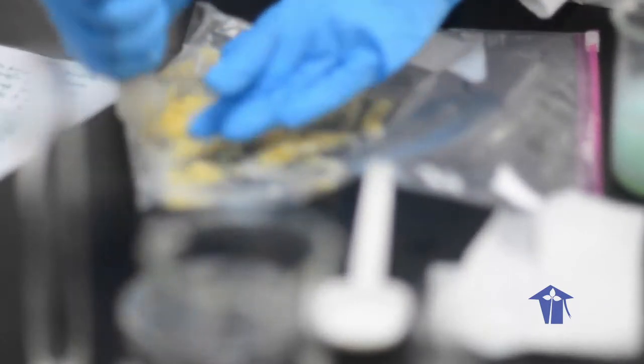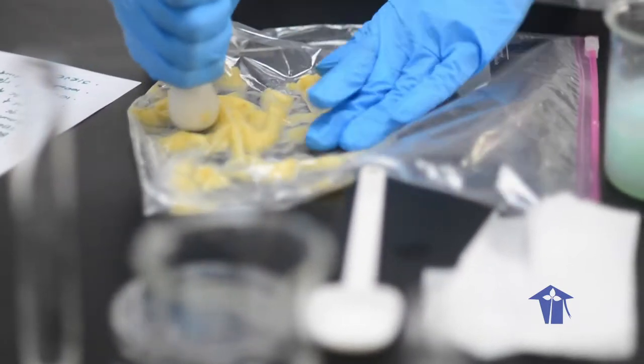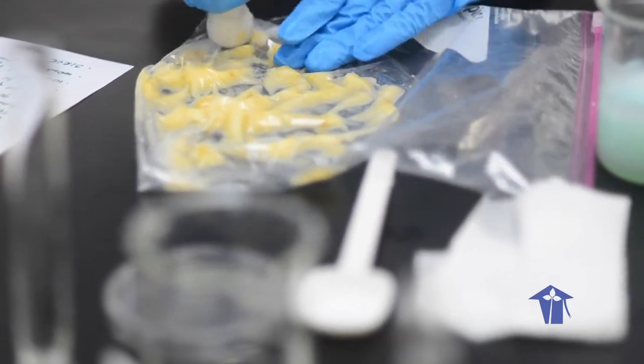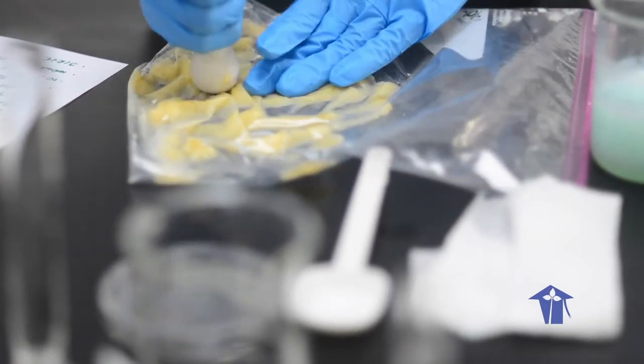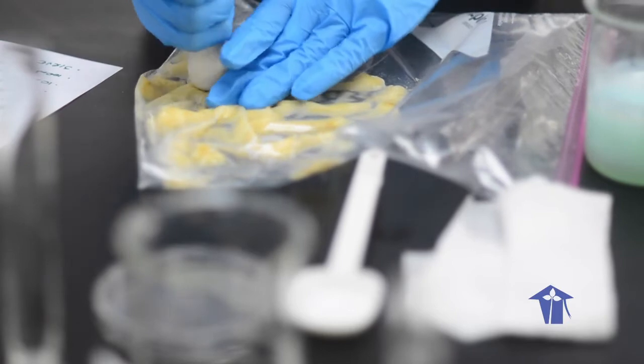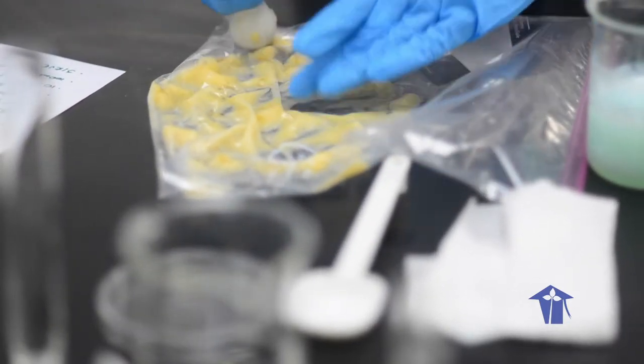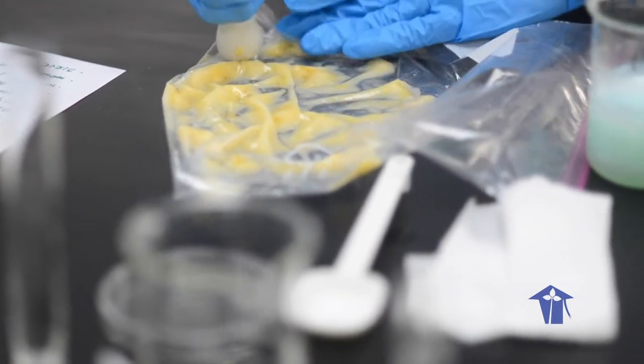Luckily, banana is a very easy to squish fruit. So, it's in a nice pasty appearance right now.